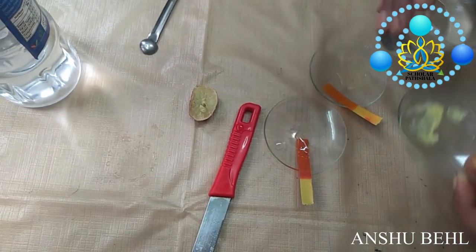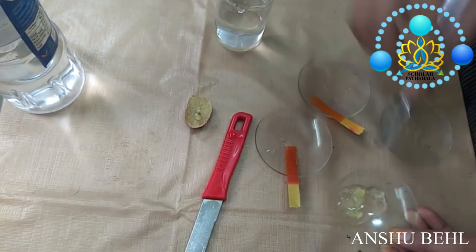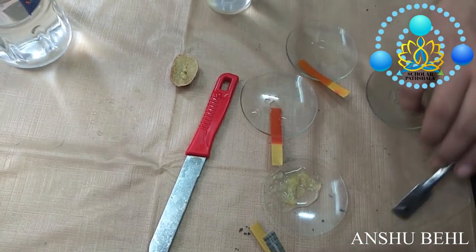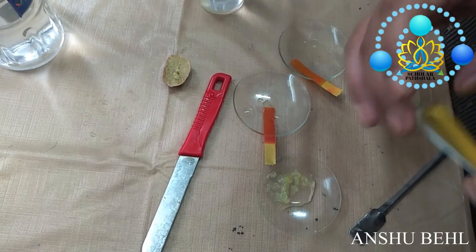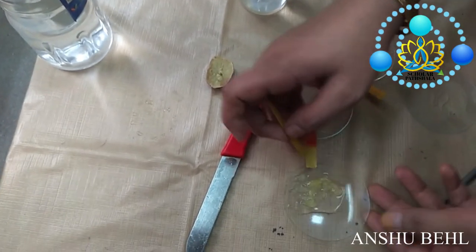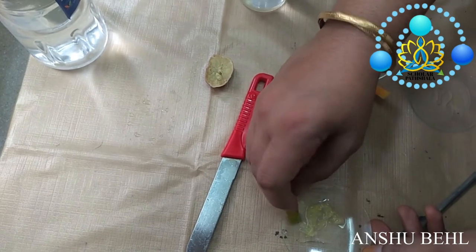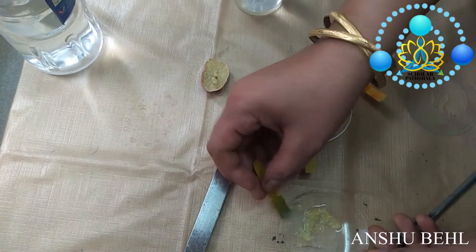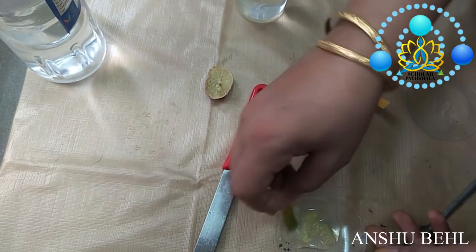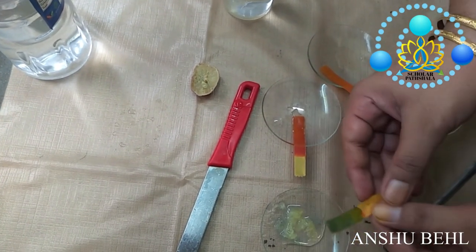Then we will take soap and dissolve it in water. We will take another strip of pH paper. This is glycerin soap — homemade glycerin soap. So we will check its pH also. It is coming green, which means it is almost neutral. If it turns blue it will be basic in nature. It is very slightly basic in nature.